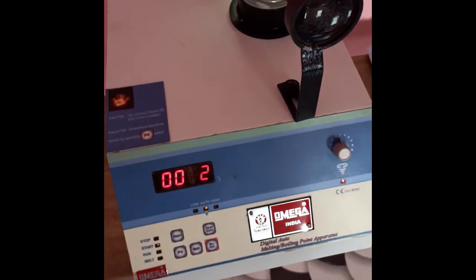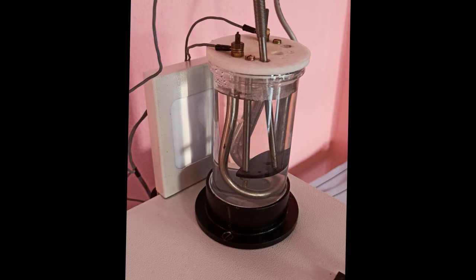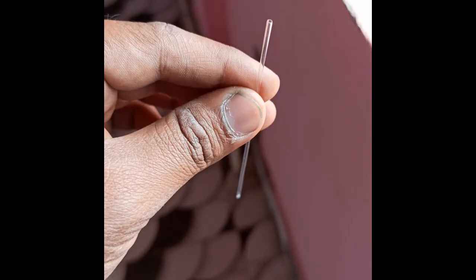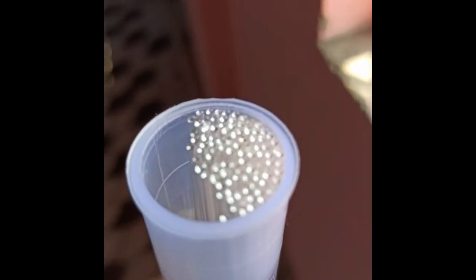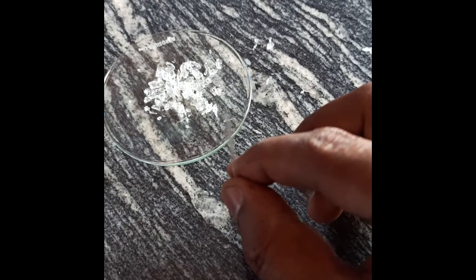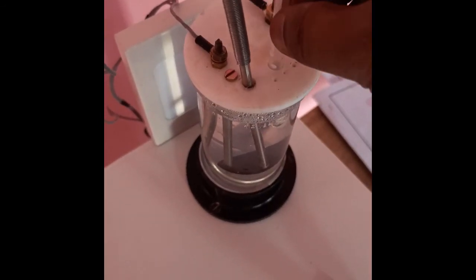Hello everyone. Today we will learn how to determine the melting point of an organic compound using a melting point apparatus. Take the compound in the provided tube. The exact melting point can be determined using thin capillary tubes like this. The given compound is taken in this thin capillary tube. Switch on the apparatus.